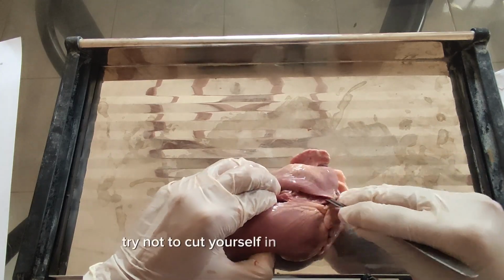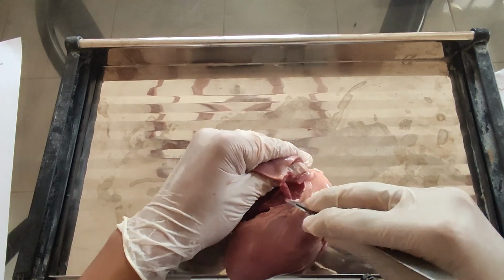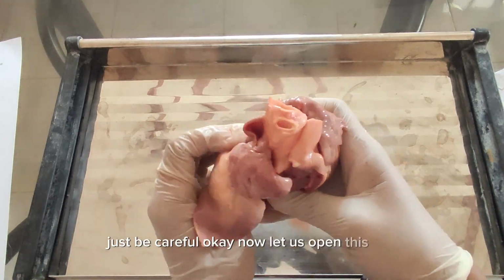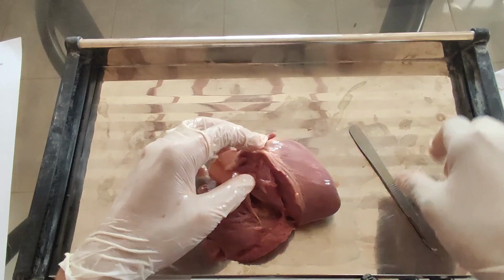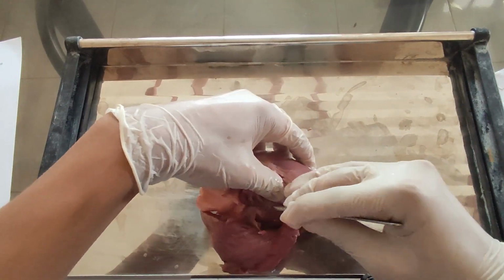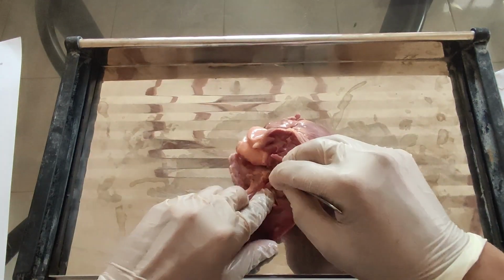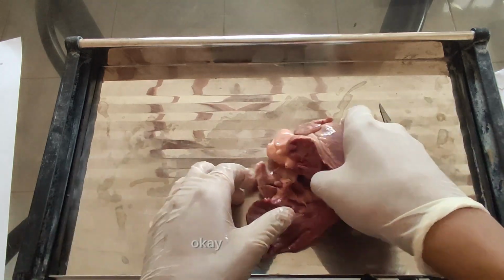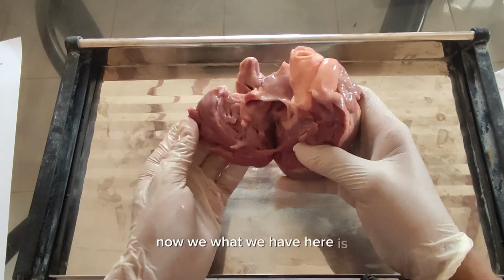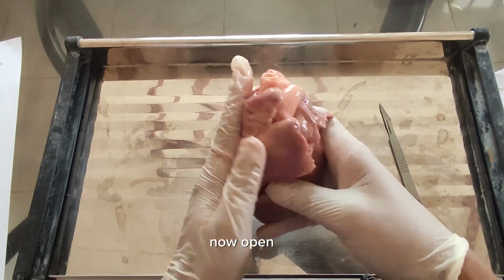Try not to cut yourself in this cutting part. Just be careful. Okay, now let us open this one. Make sure you cut enough. Let's cut this part too. Okay, good enough. Now what we have here is our right ventricle. Open up here.